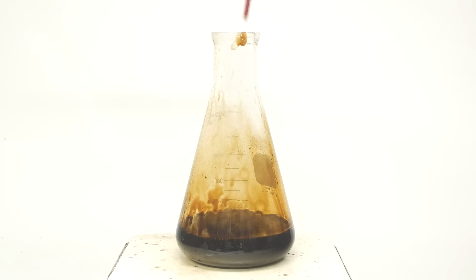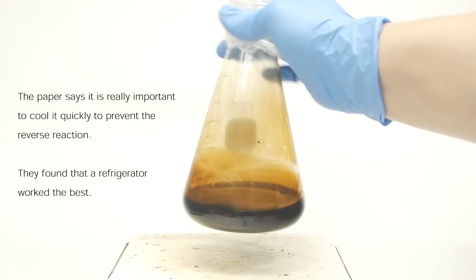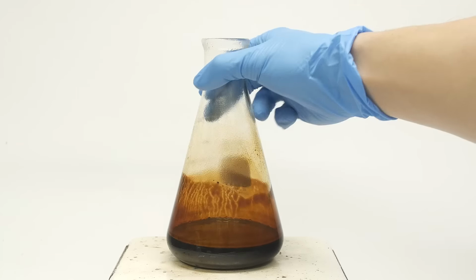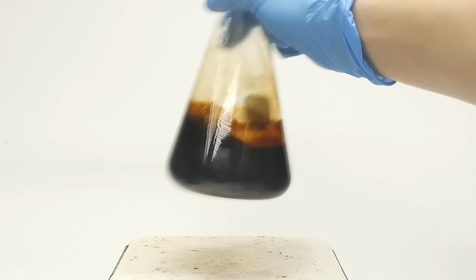The moment it finishes, I take out the thermometer and I cover the top with some plastic wrap. The entire flask is then placed into a fridge for a couple hours. A few hours later, I pull it out, and I have this brown goopy liquid.